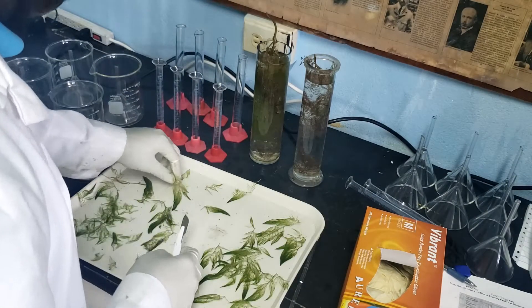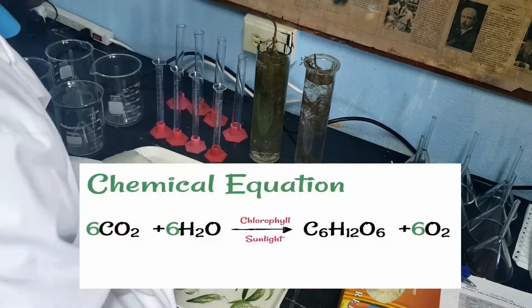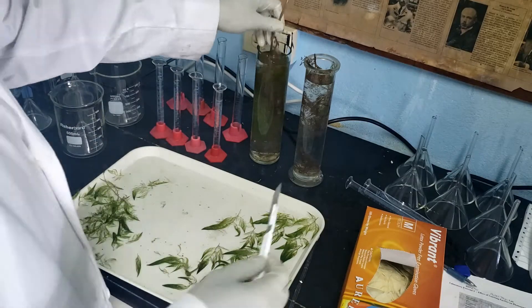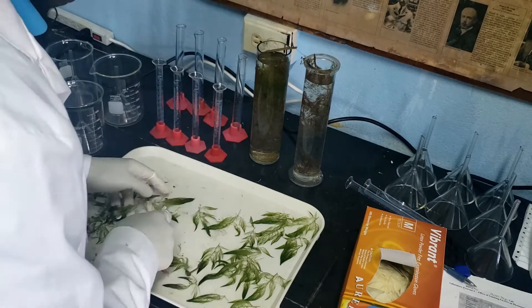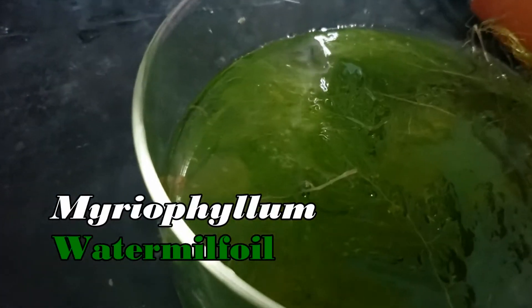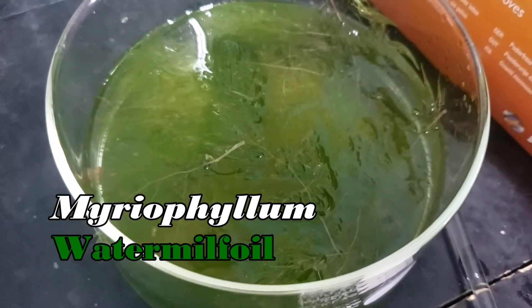In today's experiment, we'll investigate how light intensity and concentration affect the rate of photosynthesis. The pondweed is a green plant which will convert carbon dioxide and water to produce oxygen. By manipulating certain conditions, we can test how they affect the rate of photosynthesis. In order to keep the plants fresh, we try to do this preparation as quickly as possible and have the plants stored in water.